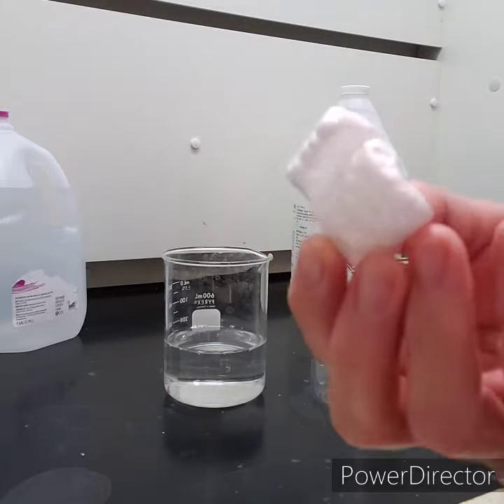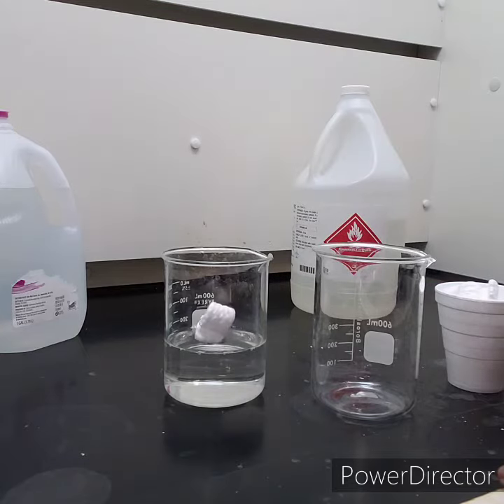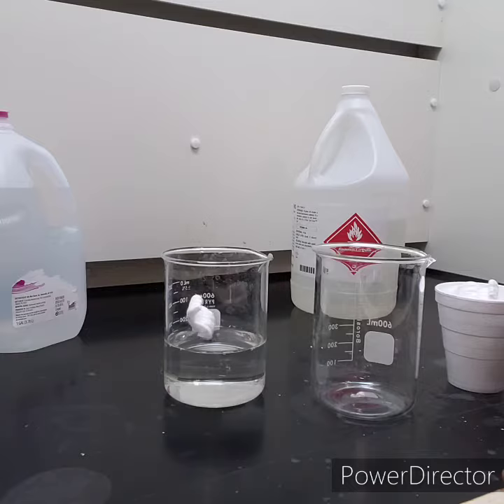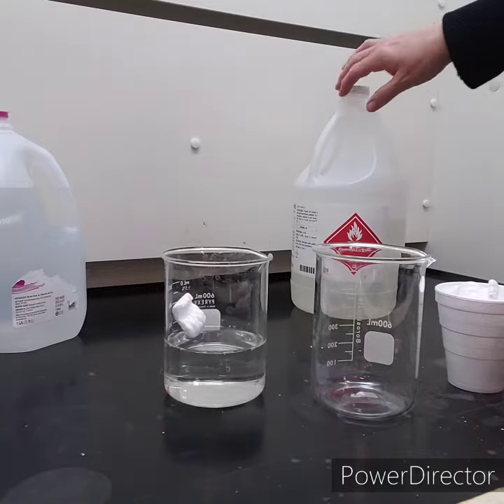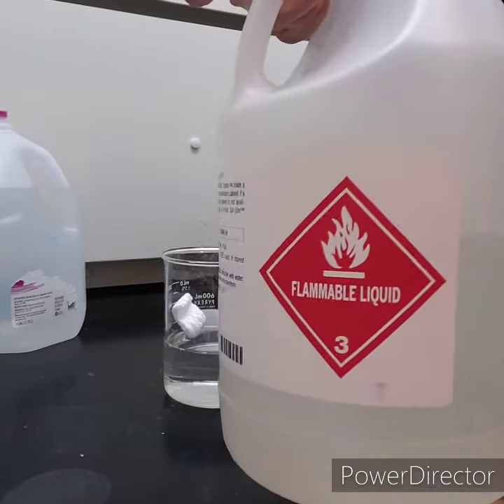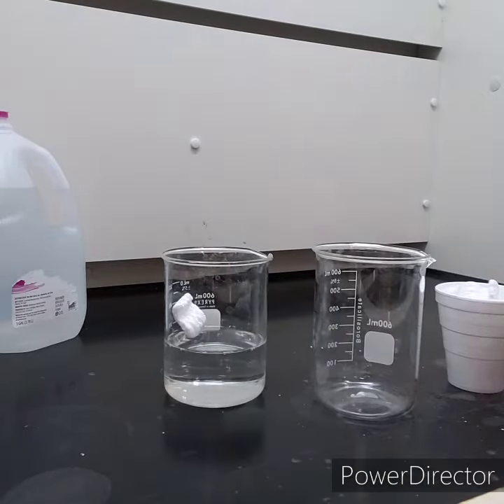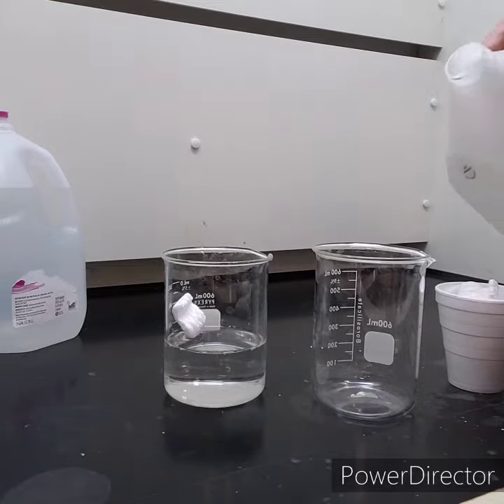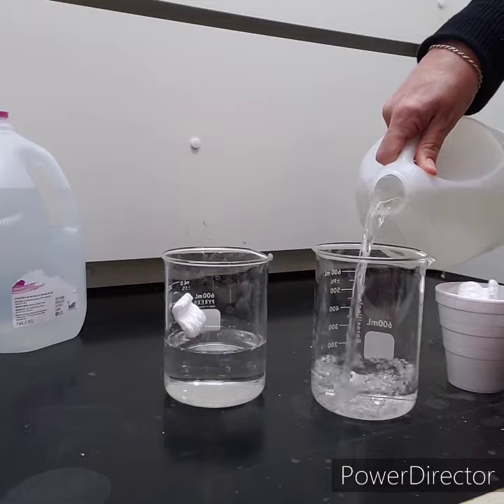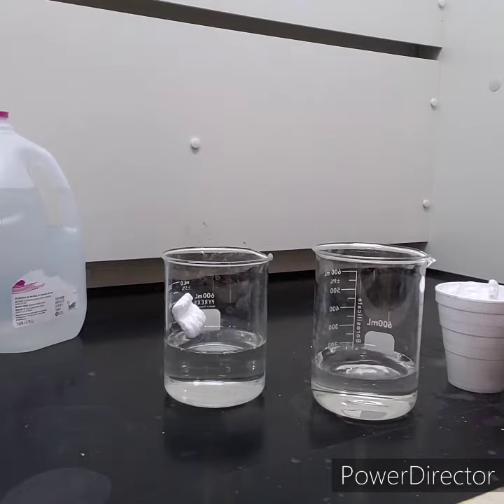Styrofoam is nonpolar, so obviously that styrofoam peanut is not going to dissolve in the water. We do have a solvent that's nonpolar — and flammable, by the way — it's acetone. Acetone is a nonpolar solvent; the flammable part is the reason why I'm using the fume hood.